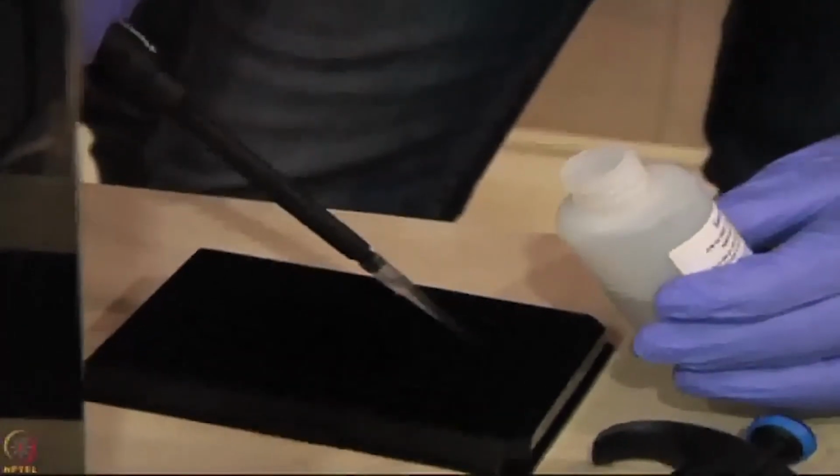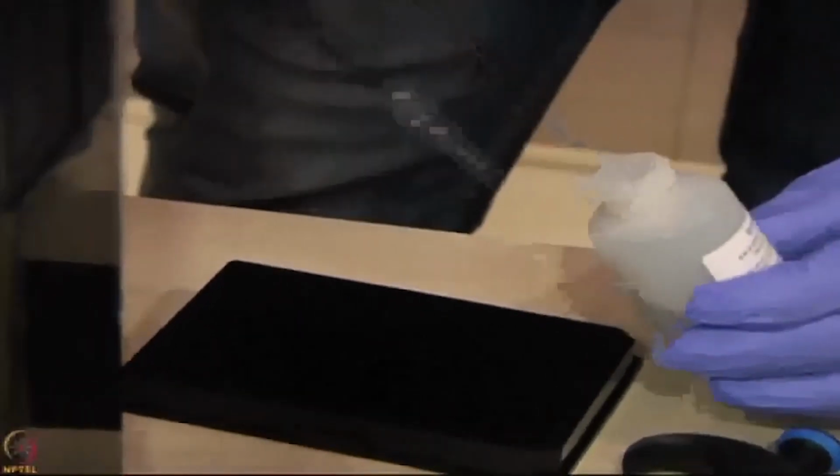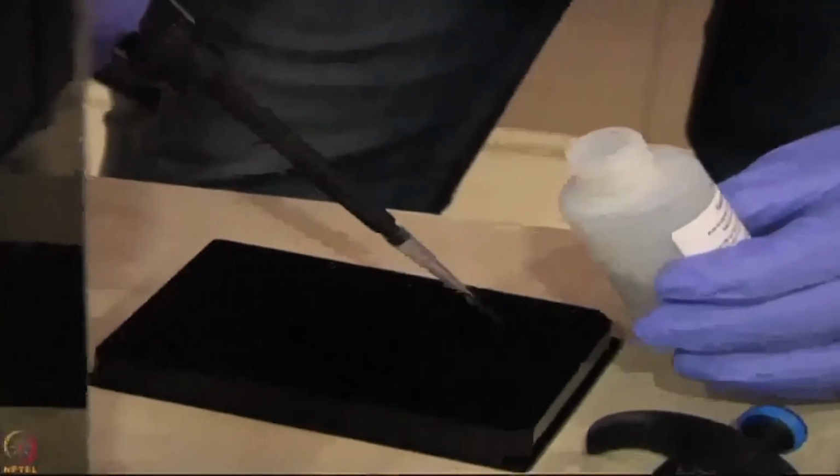The only time-consuming part is making the plate, that's all. The rest, once you make a program, is unattended; just leave it there. You didn't add in H? No, not required, just up to G is good enough, not H. We are doing it with 7 sensors.